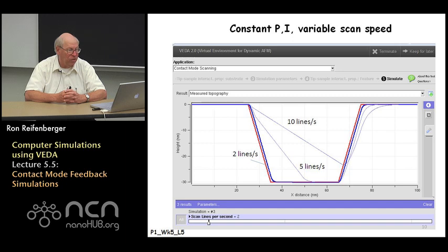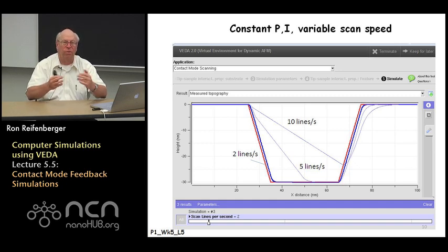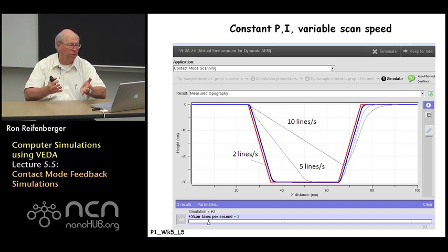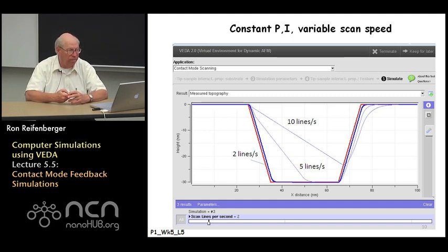However, if the scan speed is increased up to 10 lines per second, you start to make gross errors in the estimate of the feature, right? In fact, you would misinterpret the structure of the feature altogether. The topography would be completely wrong if you just relied on that 10 line per second image. You would miss the depth of the feature, and you would conclude that instead of a trapezoidal feature, you've actually got some sort of a triangular feature.